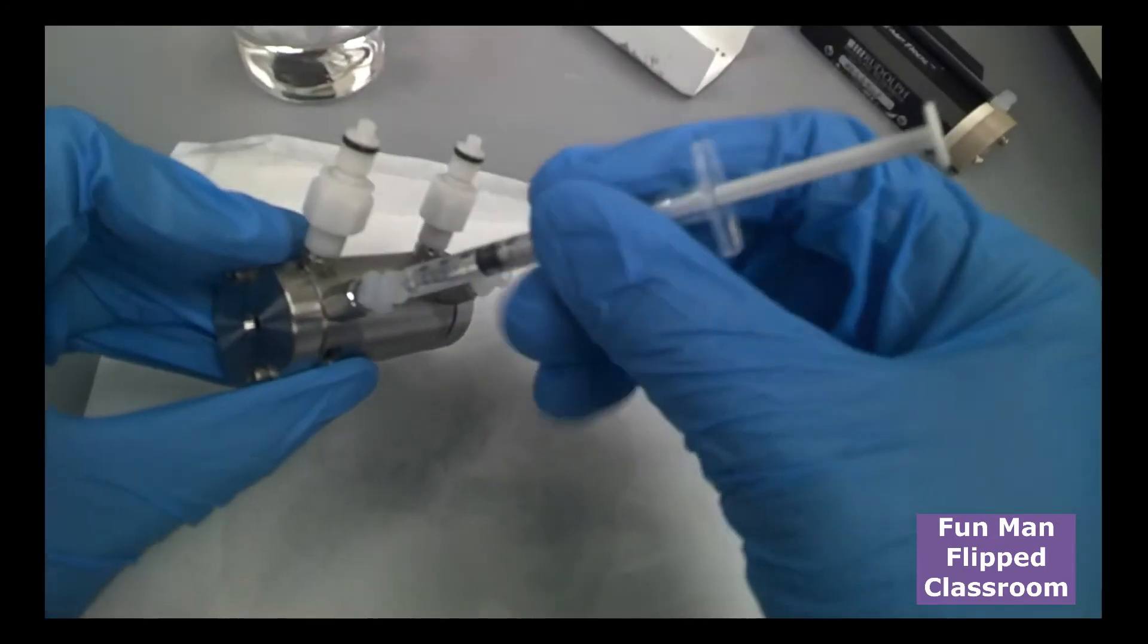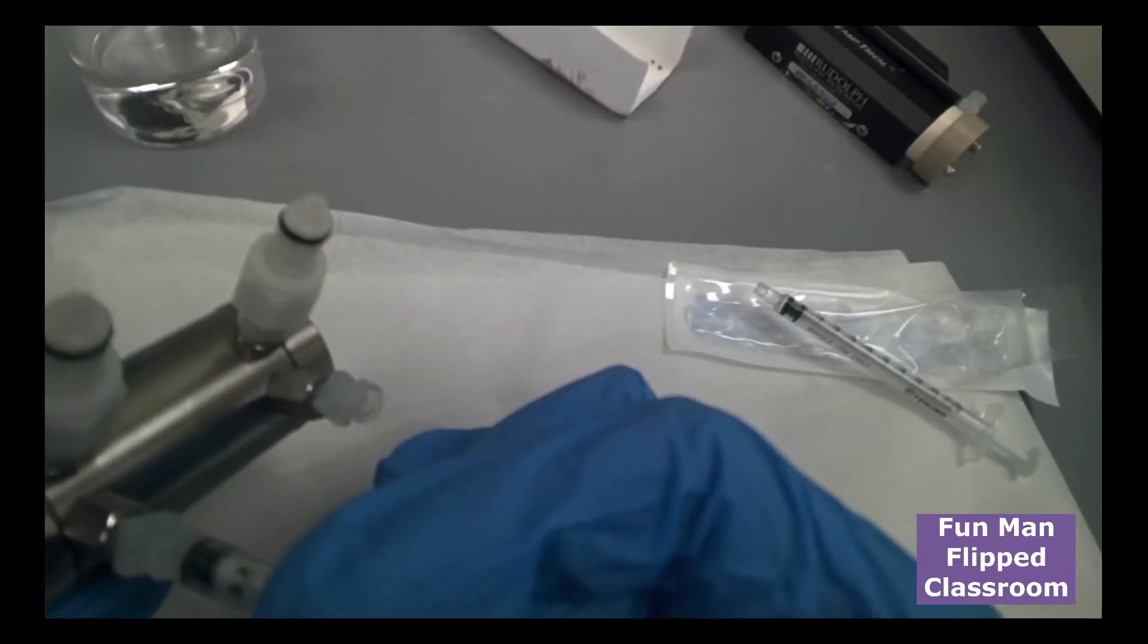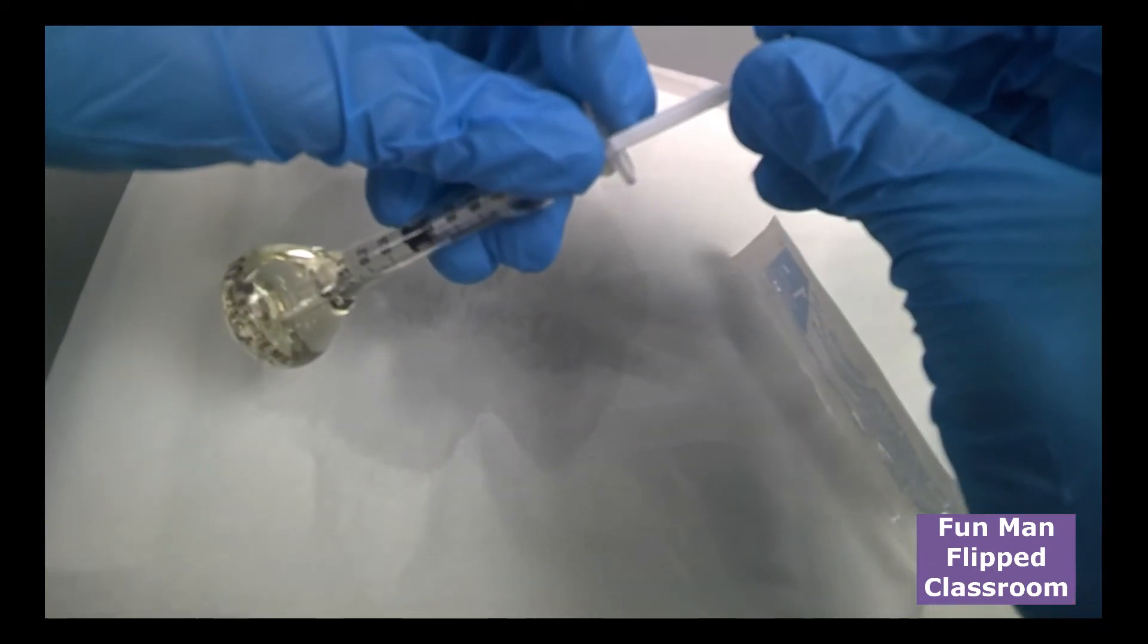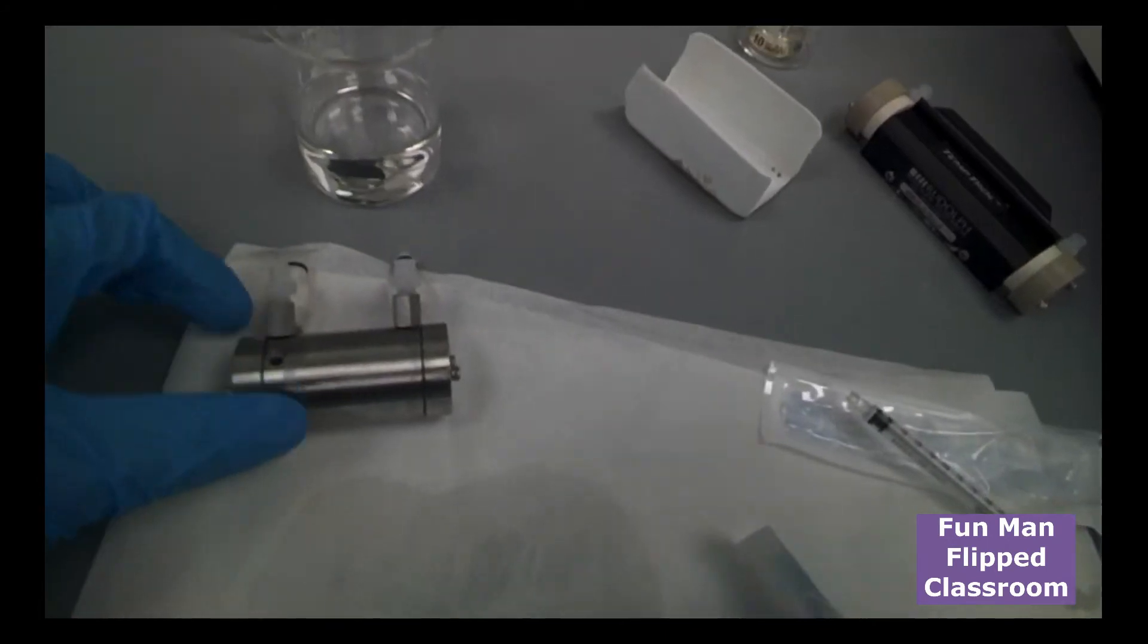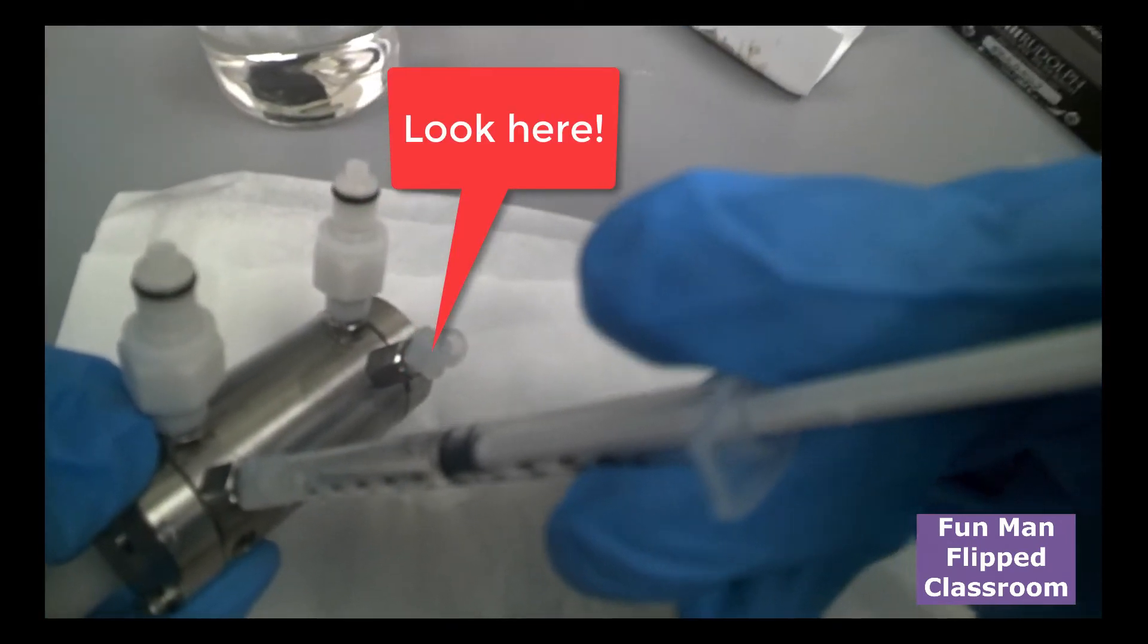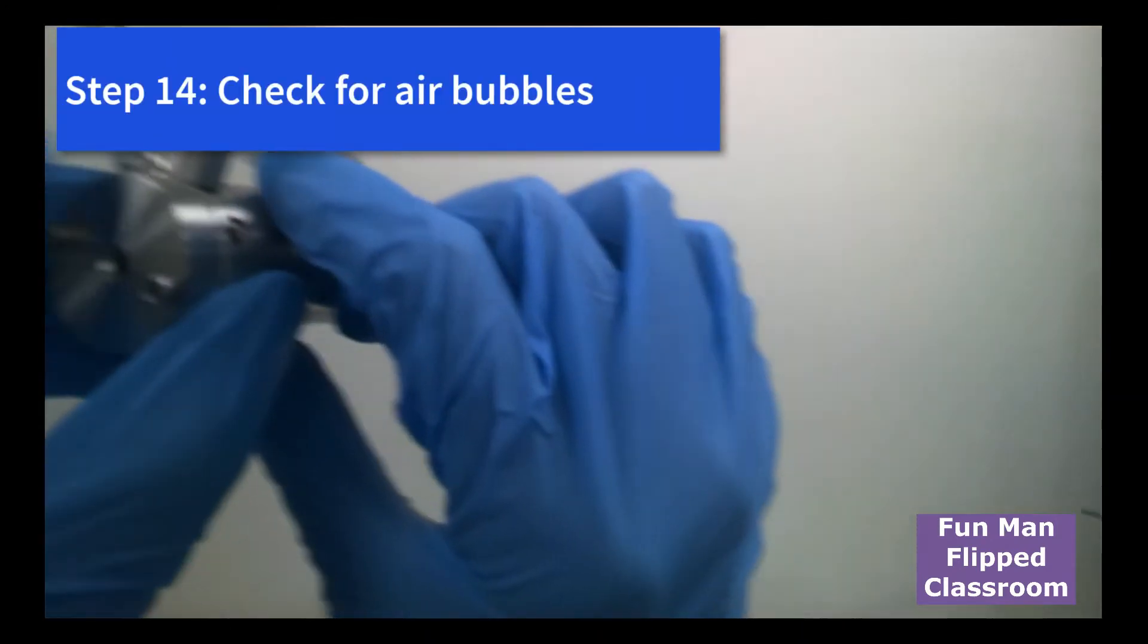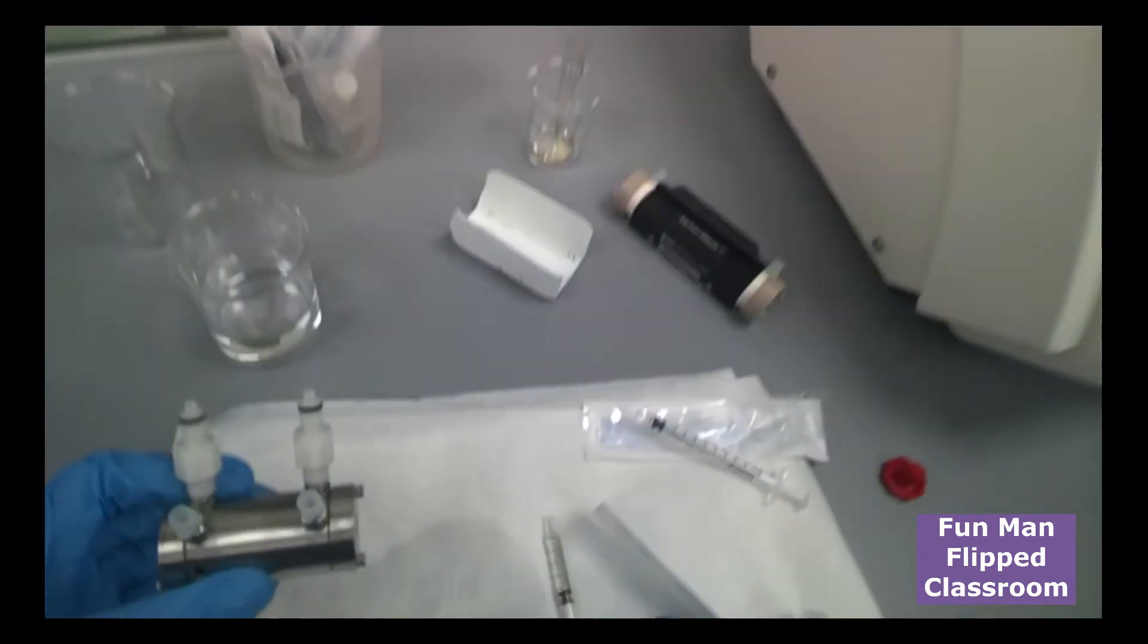If there's bubbles, it's not going to be nice. So inject some. Now no bubbles. We will put it through. Lock it. You can see the other side here, my finger. You need some more. Let's try to take some more. Again, no bubbles. Good. Push it in here. Do you see here? It comes off. That means it's enough. Remove it. We rinse it once just now. So we wipe it clean. Again, check for bubbles. So again, there's no more bubbles. Perfect. If there's bubbles, do it again.